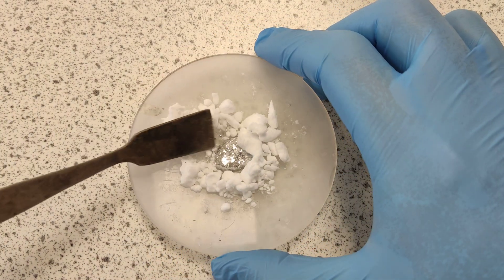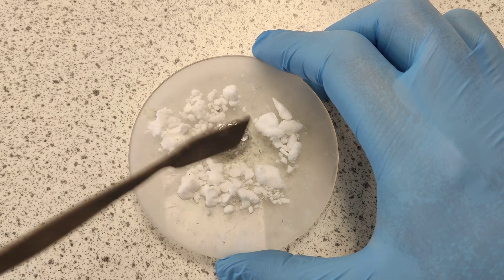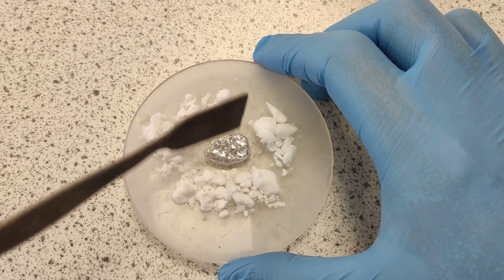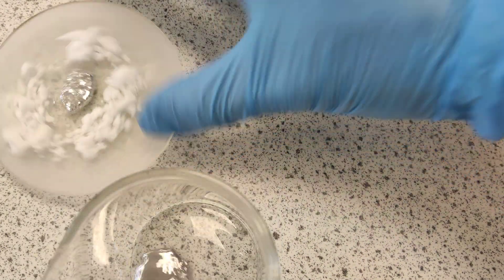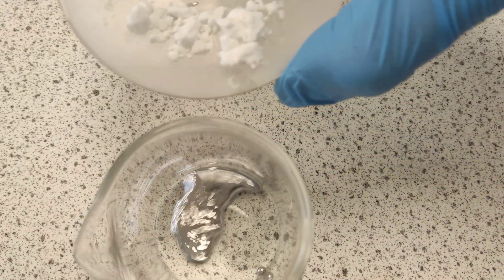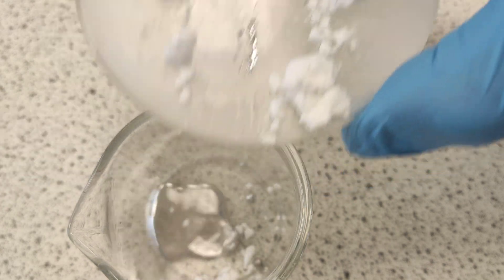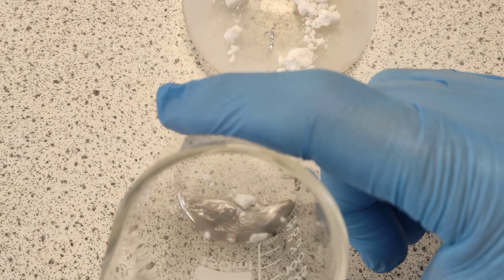Let's see what happens now. We've given it a bit more time — and look at that. There is a little block of liquid mercury turned solid. That's solid, isn't it? Now here's the exciting bit — it won't take it long. So if I drop it back in the liquid mercury, it almost instantly liquefies. Watch this — and it's gone. Literally as fast as that.